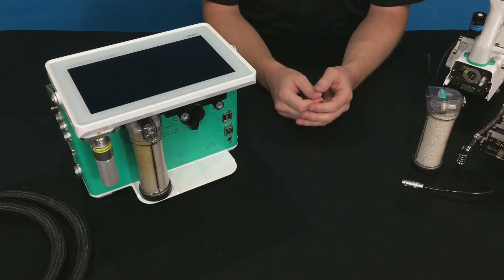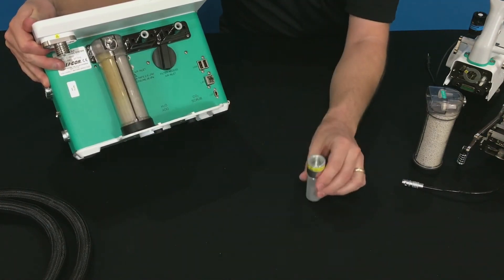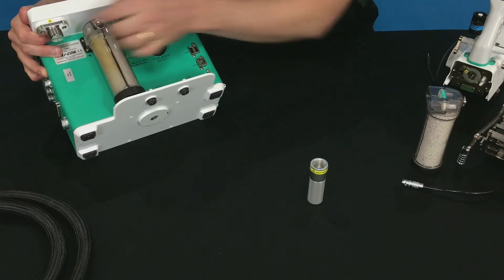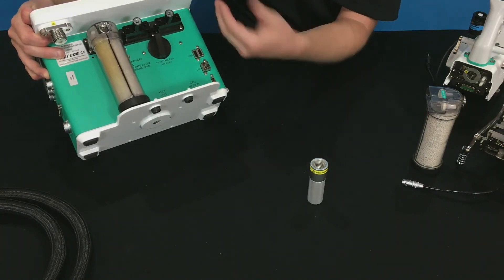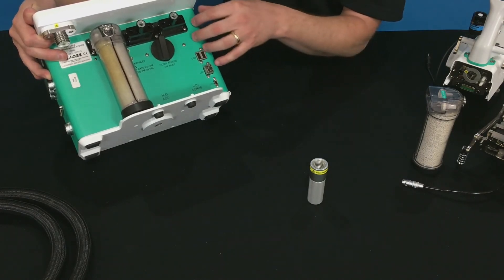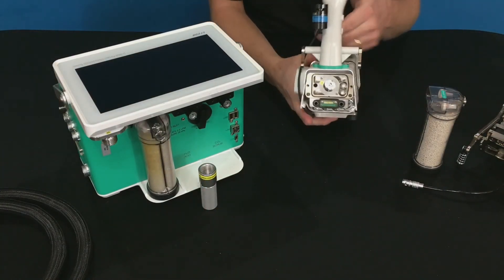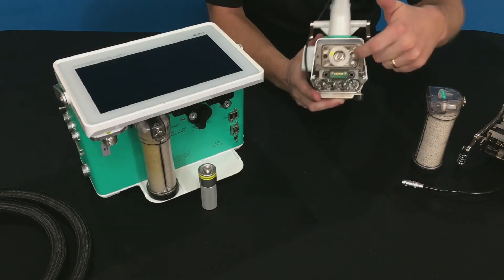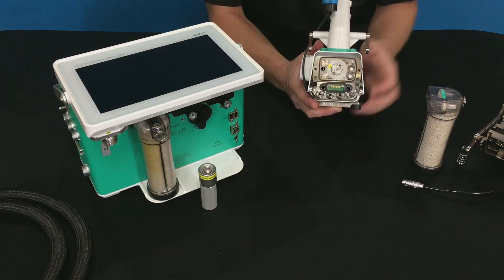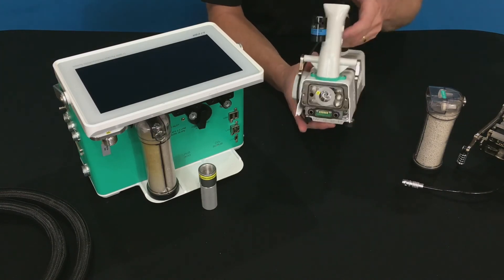On the system, we have a few O-rings. The first one is on the console — if you remove the CO2 injector cap, you'll see a small white O-ring underneath. That O-ring is captured and should be retained every time you change a CO2 cartridge, but occasionally you want to inspect it for dust, dirt, or contamination, and make sure it's in place. The other O-ring to inspect is on the sensor head. When you remove the chamber, you can see an O-ring around the mating plate between the sensor head and the chamber. When you change chambers, inspect it to make sure it's in place and not contaminated or dirty, as that would cause leaks.